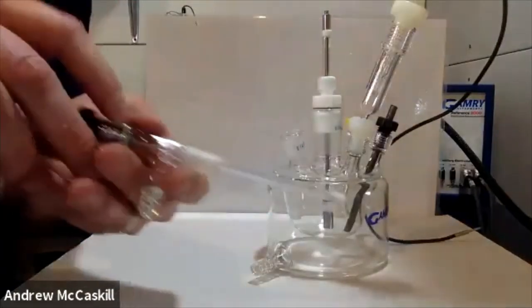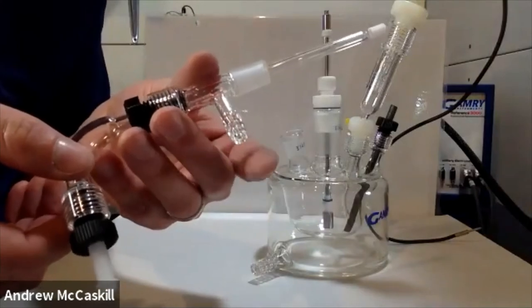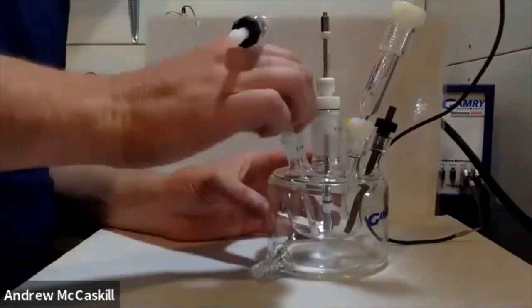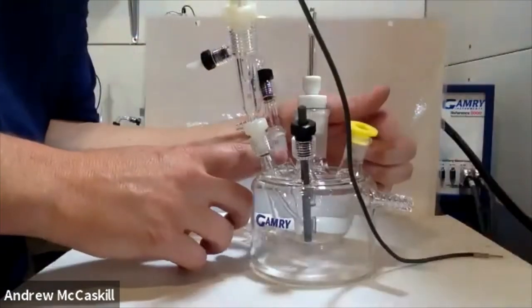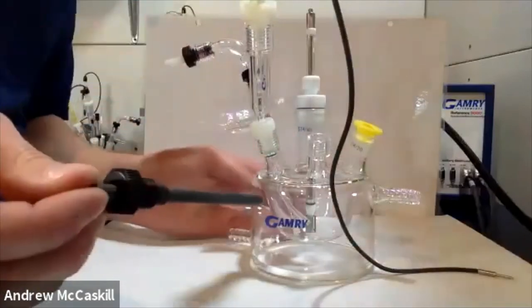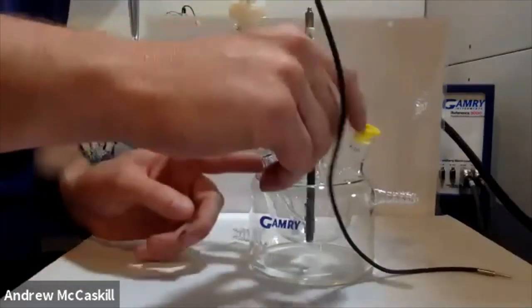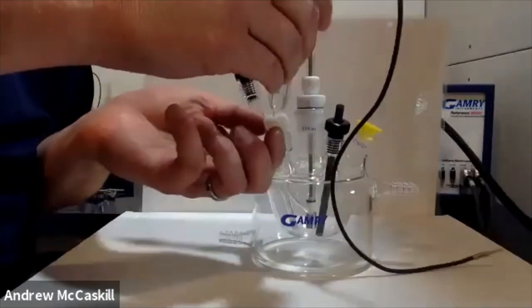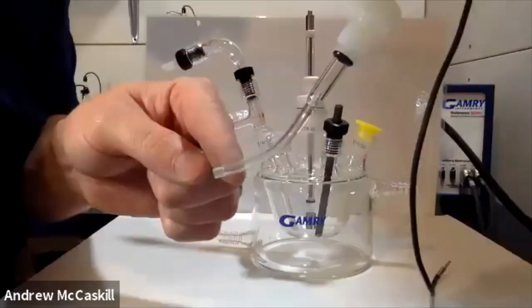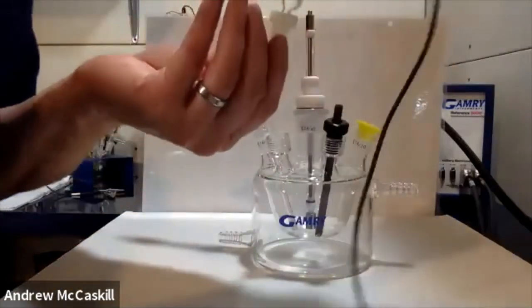The same gas bubbler as on the Dr. Bob Cell is included here — you can sample from the headspace or degas, or introduce gas to blanket the surface or bubble into the solution. These are 14/20 fittings just like on the Dr. Bob Cell. On the other side is another 14/20 fitting. With the Euro Cell, what's included is a graphite rod counter electrode — again notice the o-rings on the bottom that create the seal. We also have a bridge tube for this cell, which actually has a curved end so you can see the glass frit. The reference electrode is removable.